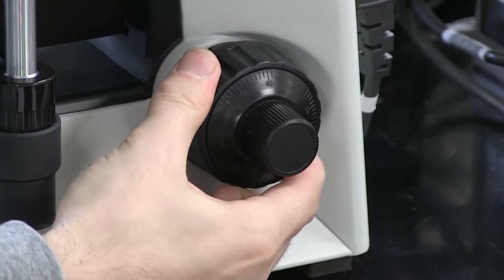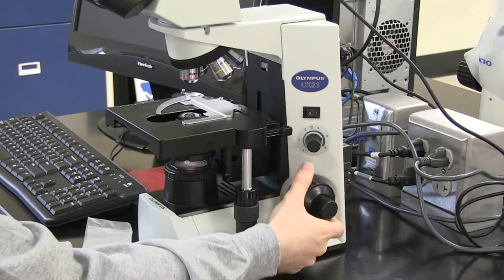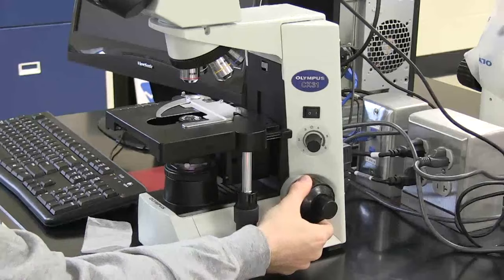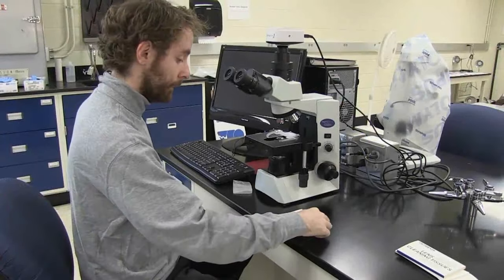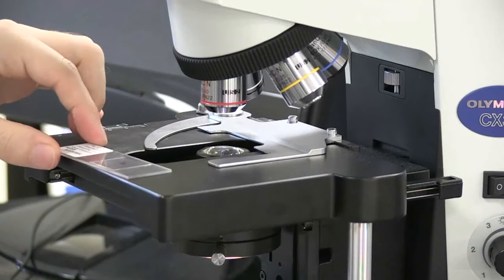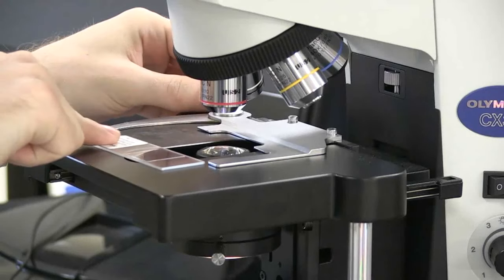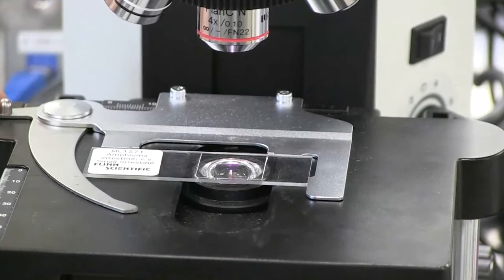Using the coarse focus adjustment knob, lower the stage. Place your slide onto the stage. Notice how the slide locks into place.